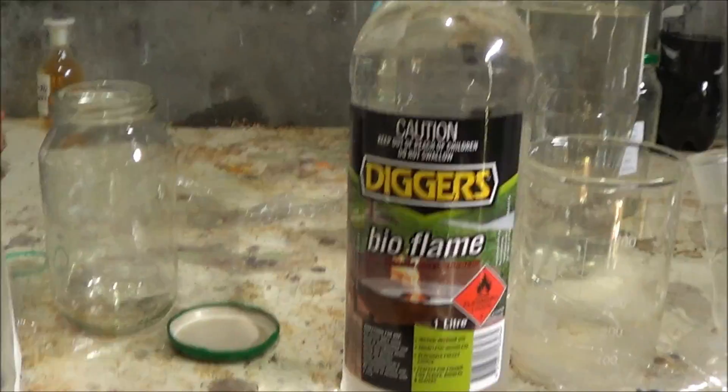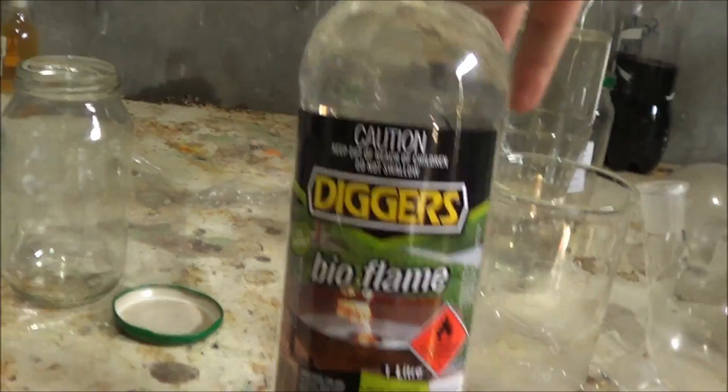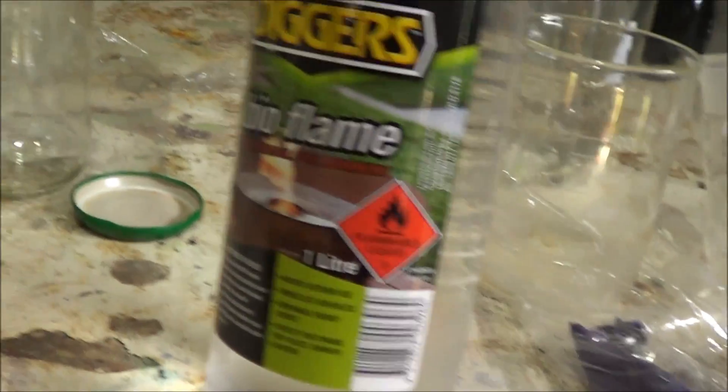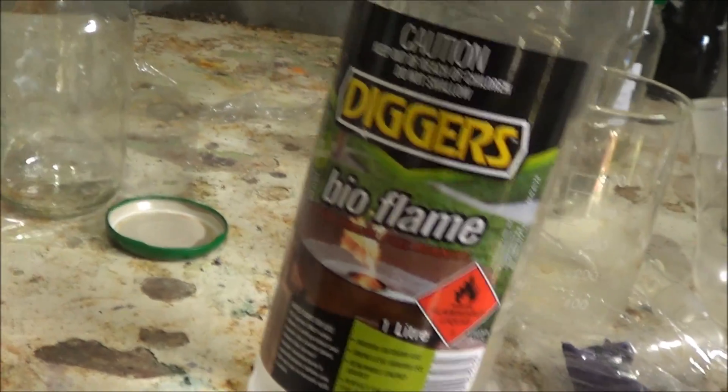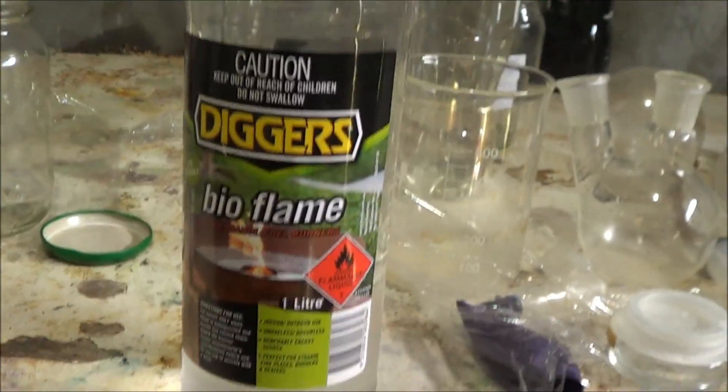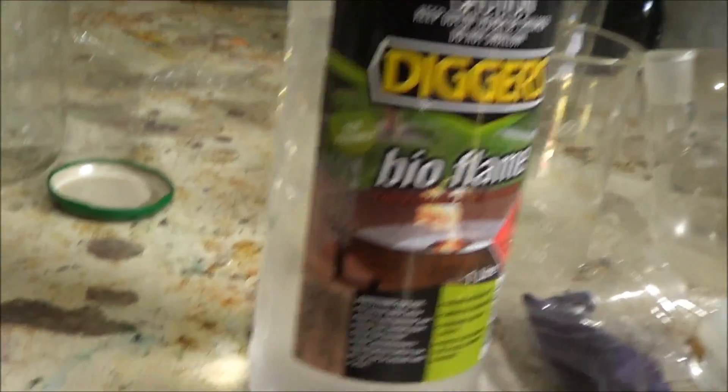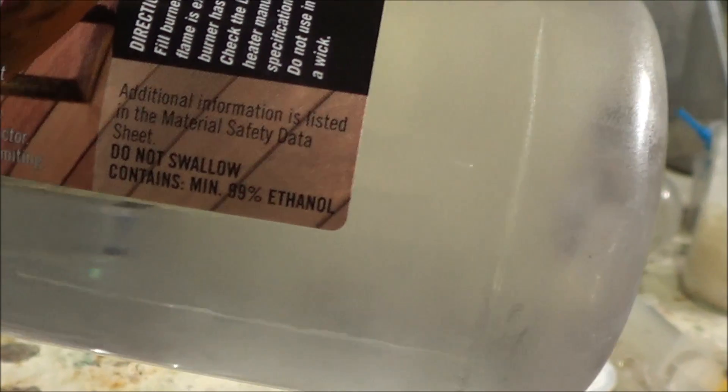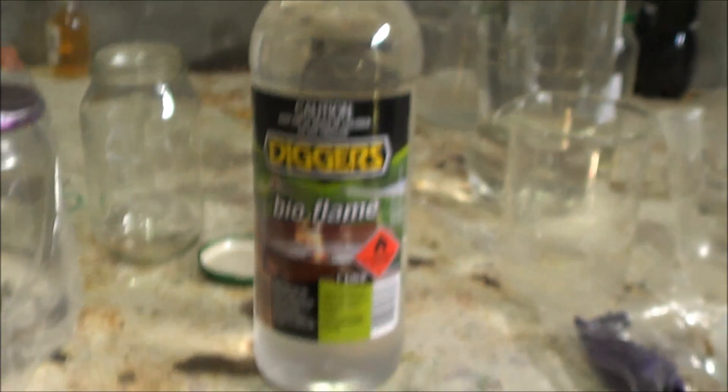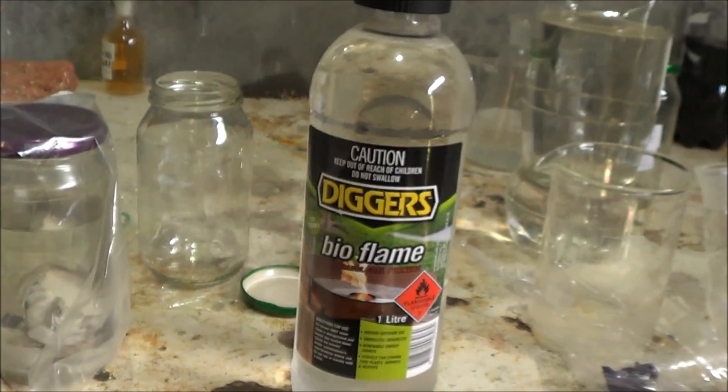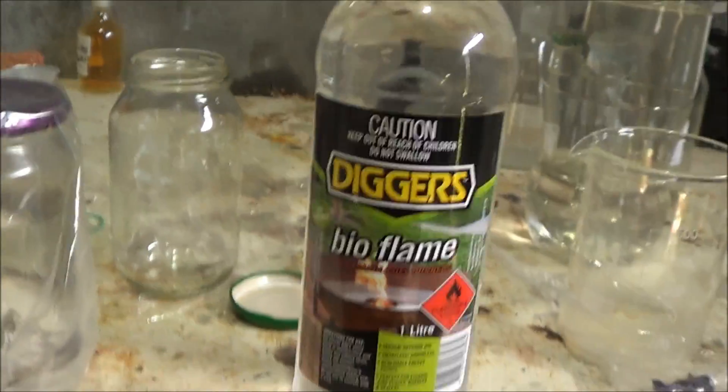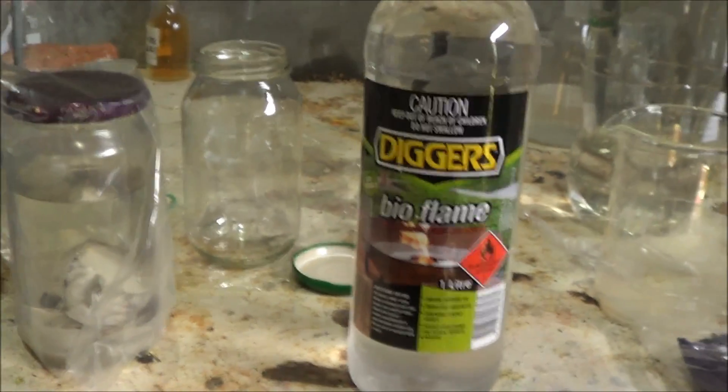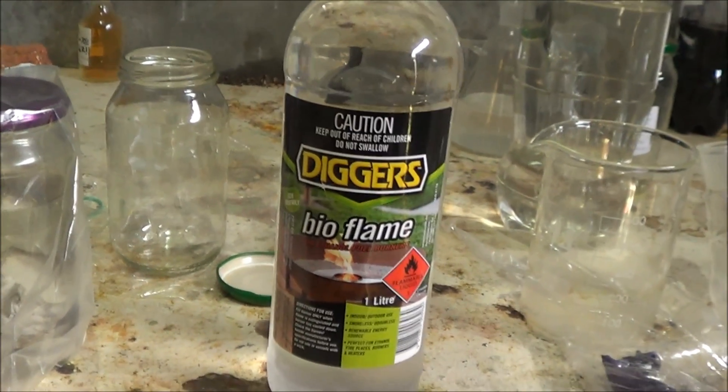So what we have here is this thing called bioflame which I bought today. I found it with the help with the tip off from a fellow Science Matters member. Thank you Science Matters once again. Now this may look like 95% ethanol. The packaging looks about the same. But if you look right on the side it is 99% ethanol. Which is pretty significant because ethanol does form a 95% azeotrope with water.